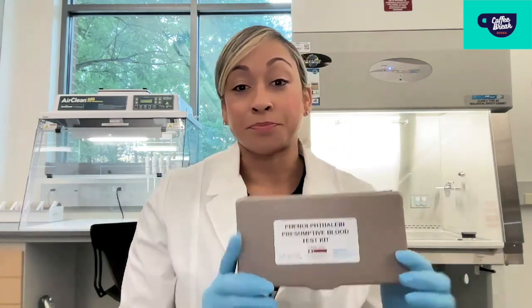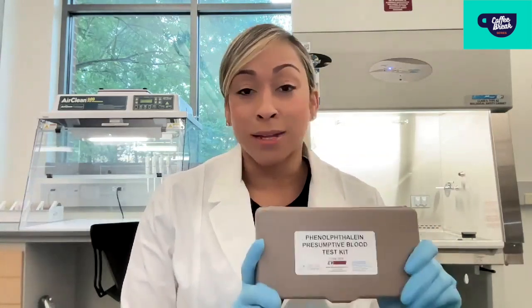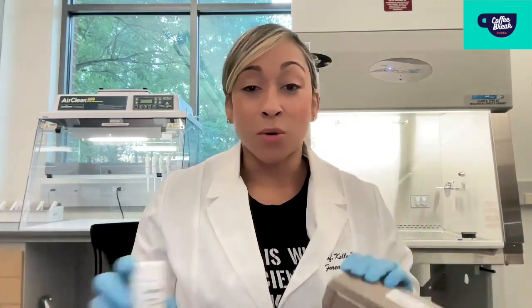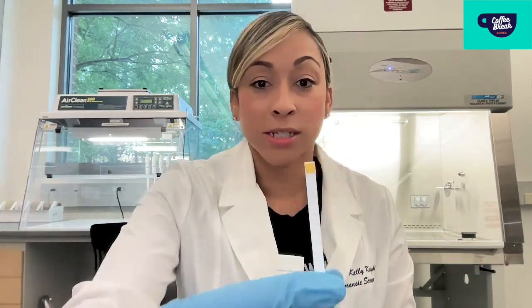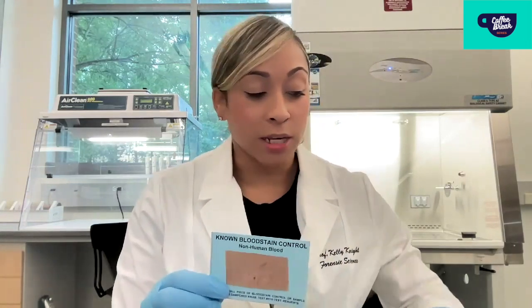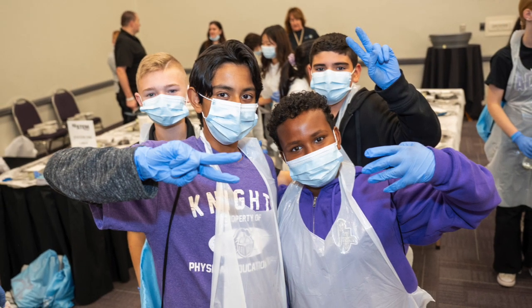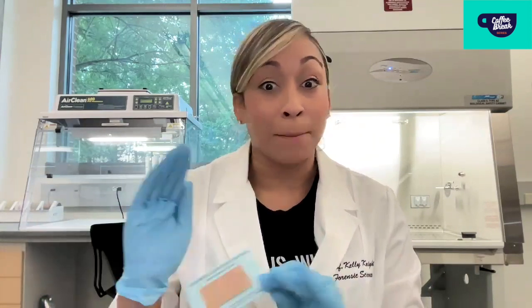I like to use either the phenolphthalein kits or hema sticks. If you are not afraid of getting a little messy, the phenolphthalein kit only has three chemicals that come in squeezy bottles and is very easy to use. Or if you don't want to deal too much with chemicals, hema sticks are really easy to use as well. It's just a simple little stick with a chemical pad at the end used for your reactions. I suggest working with K-12 students to use synthetic blood, because you get the same color change with your reactions minus all of the biohazard. Synthetic blood can be purchased in bulk online and will work well with any of these chemical tests.